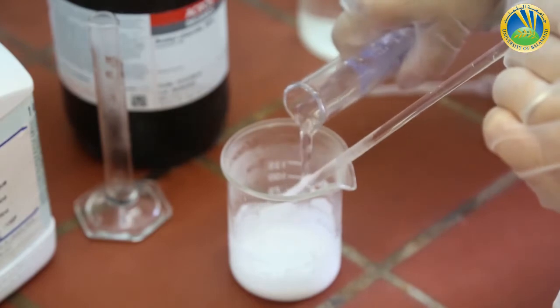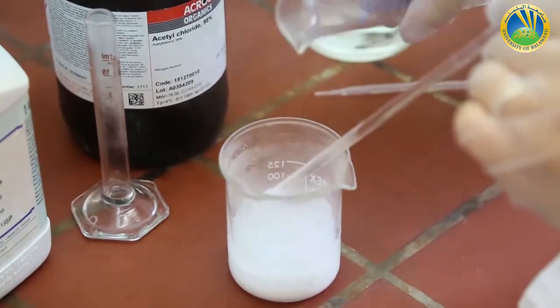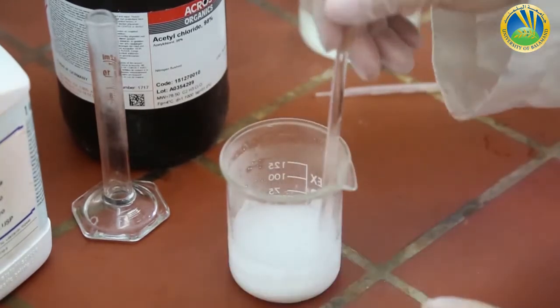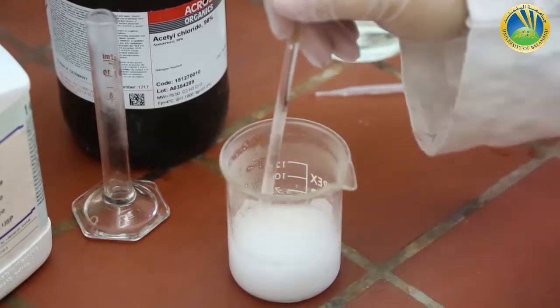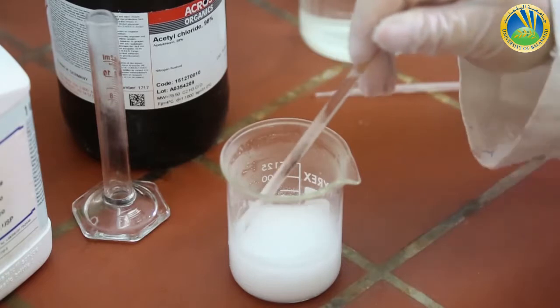So now I'm adding 50 milliliters of cold water to put the crystals in suspension to filter them using the Buchner filter on the bench, not under the hood.